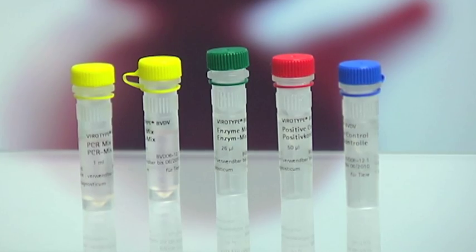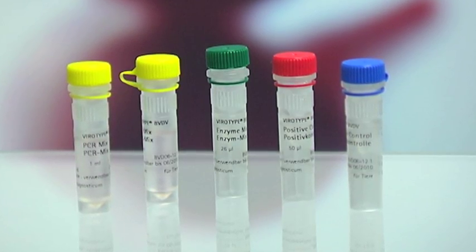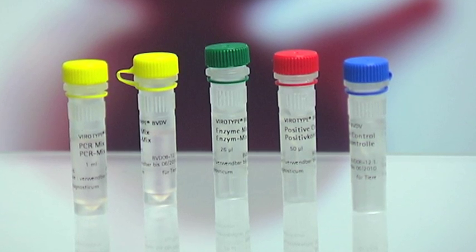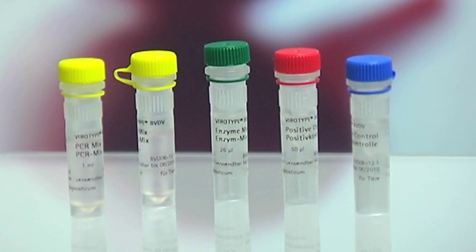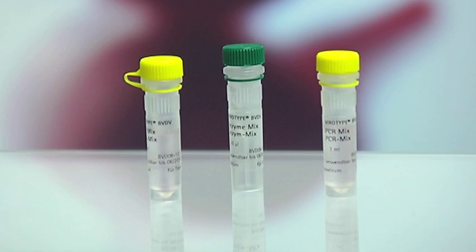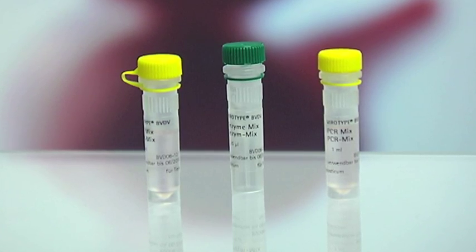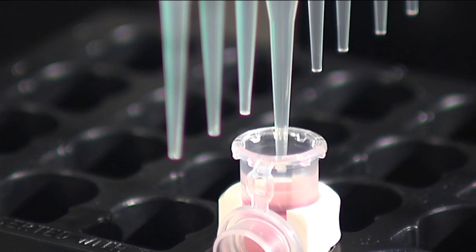The bovine viral diarrhea virus is detected using the LDL Viro-type BVDV test kit. A mix of two components from the kit is automatically transferred to the PCR plate.